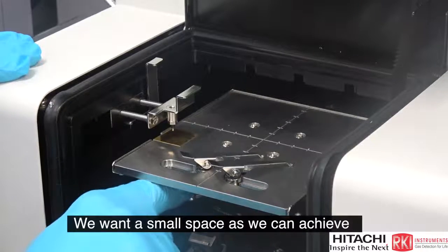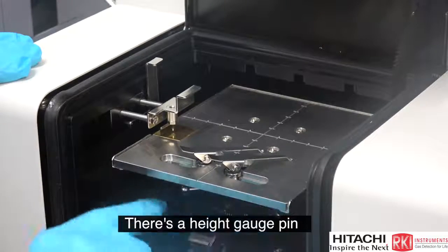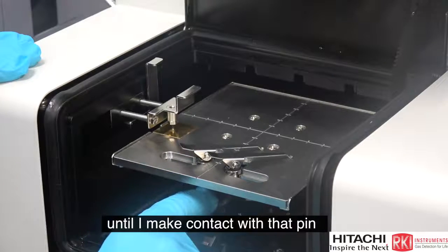We want as small a space as we can achieve. So basically I'm going to raise the sample tray back up. There is a height gauge pin with a retractable pin. I'm going to go slowly until I just make contact with that pin.